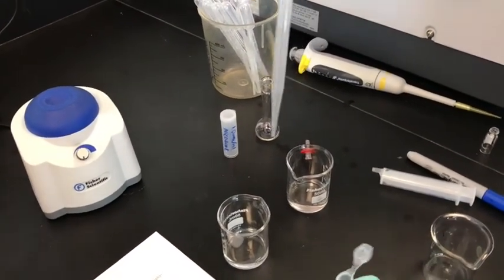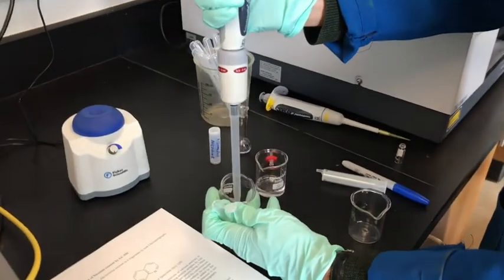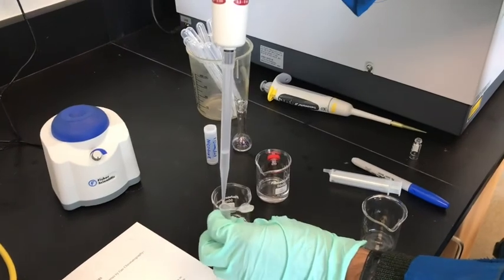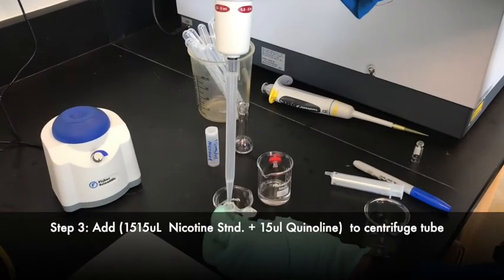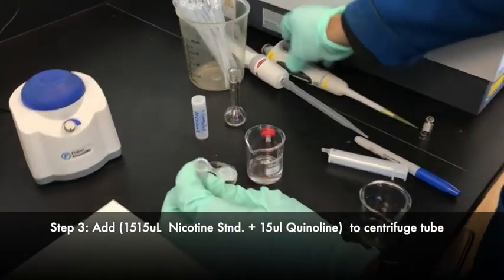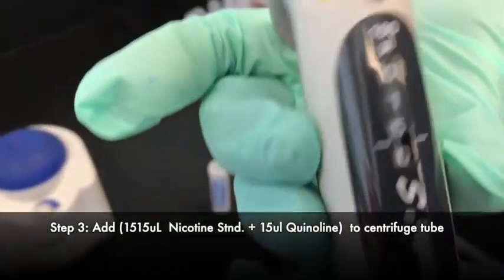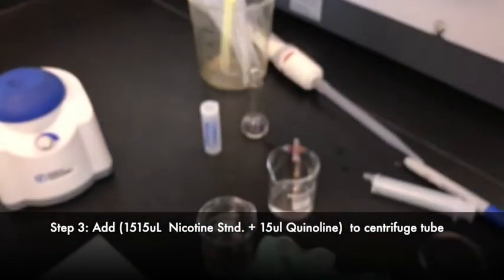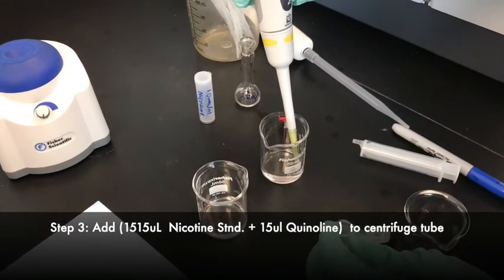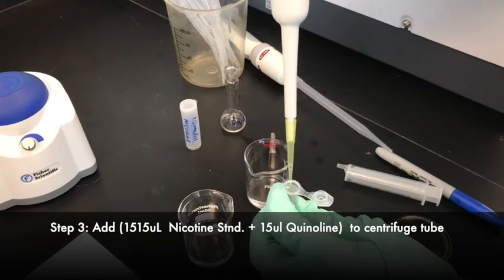Let's pipette out the nicotine sample and put that into a micro centrifuge tube. Then we're going to pipette 15 microliters of quinoline, which was already prepared for us, and transfer that into the same micro centrifuge tube.